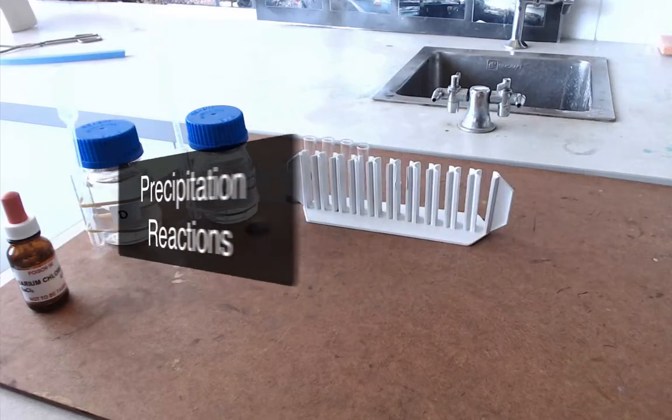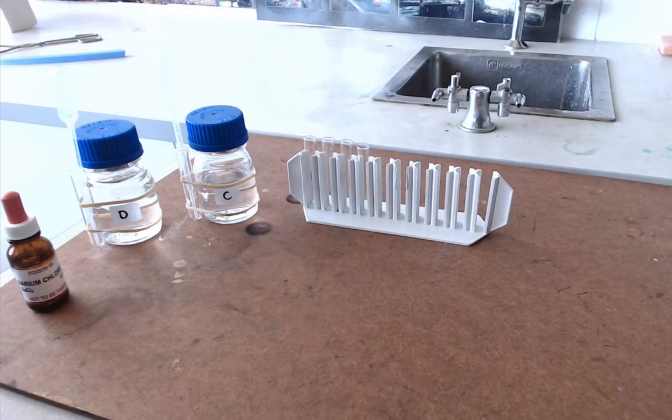Hello and welcome to this film which is all about the precipitation reactions practical. There are actually four sets of tests to do in this practical, but I'm just going to talk you through one of them.